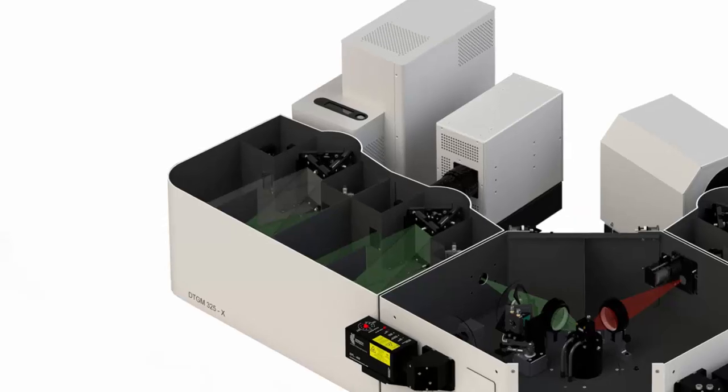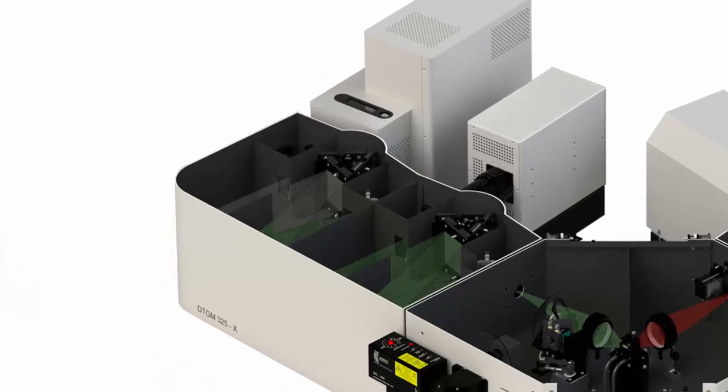The excitation arm here shows a double Czerny-Turner monochromator, 2 grating turrets with the capability for 3 gratings each, and 2 lamps. Larger for the steady state is a xenon 450 watt lamp, and the smaller one is for phosphorescence measurements, a 60 watt microsecond lamp.